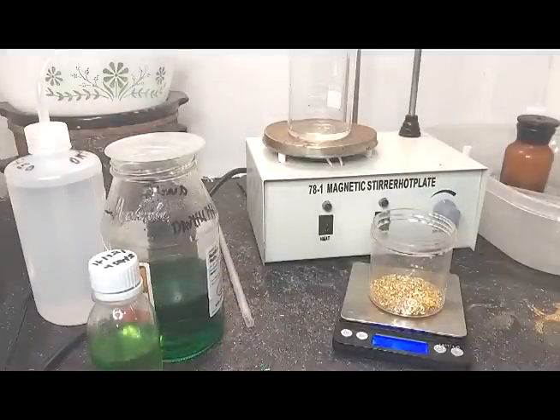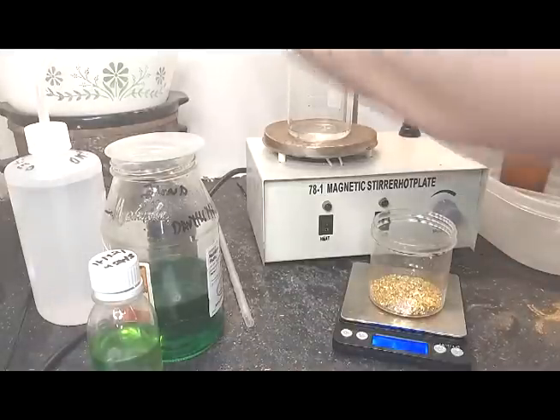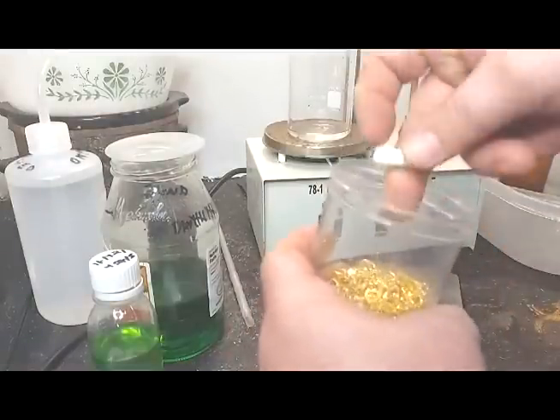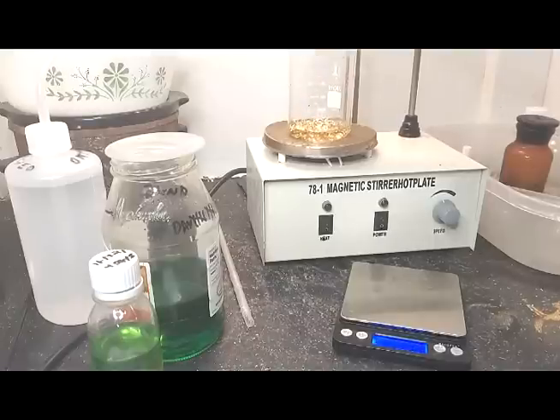It's a very simple experiment. We're going to put it on the stir plate. We're going to try to keep it stirring if it's possible. I don't know if we can because this stuff may or may not be magnetic. It should be copper — I'm hoping it's copper. Yeah, it's copper. Alright.